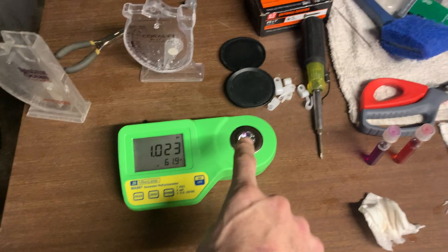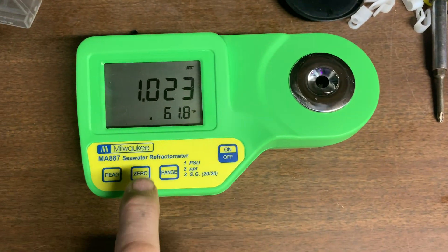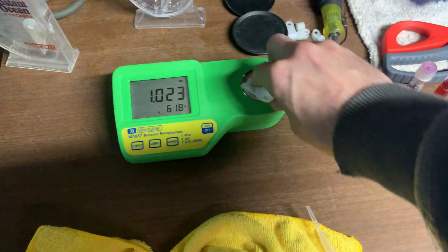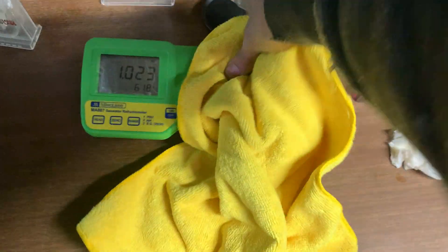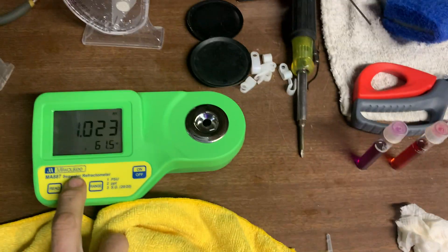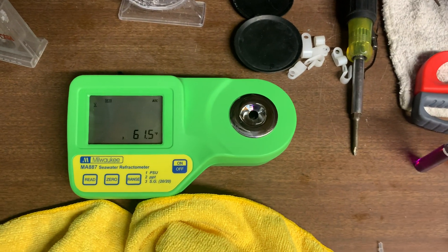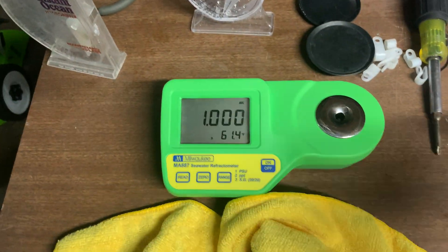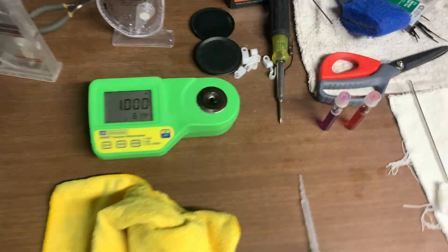I have my $1 bottle of distilled water here. I drip the distilled water in there and you hit zero and that's it. I'll show how easy it is. Always use a microfiber cloth or something soft on that surface. And you just hit zero. Take it out of there. Dry it up and that's it. It's calibrated.